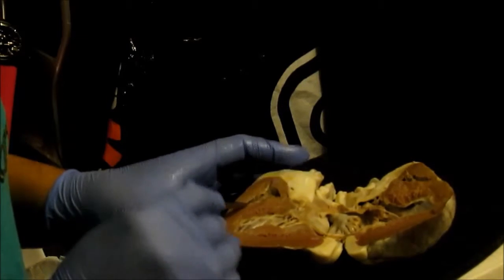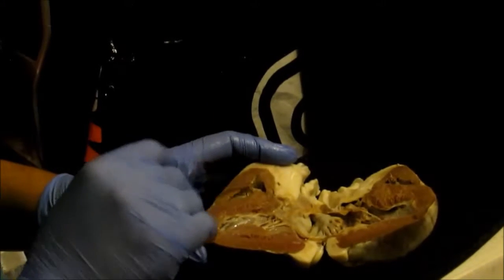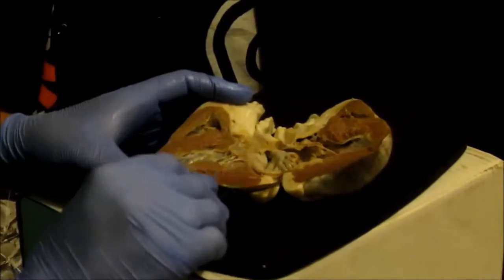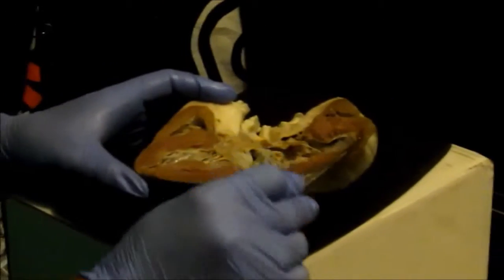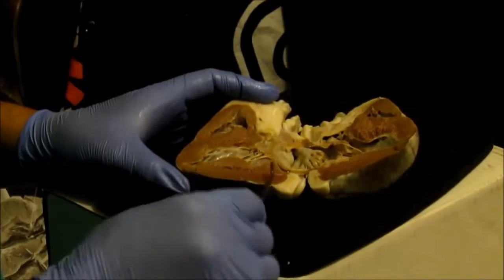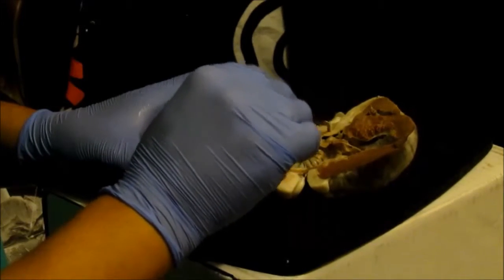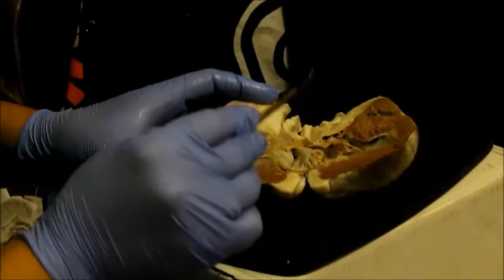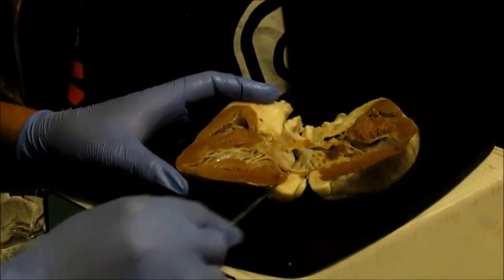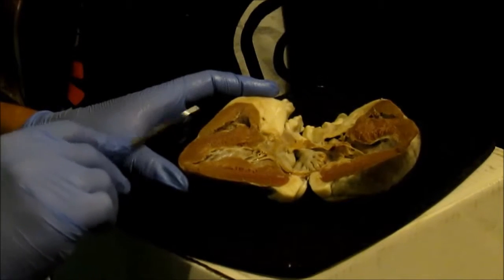The right ventricle has the deoxygenated blood, and then this goes into the pulmonary circuit to get reoxygenated. When it comes back into the left ventricle, the left ventricle needs all this muscle power to push it through the aorta so that the arteries, which are rich in oxygenated blood, can pump it into the rest of the body. That is why this is a lot thicker than the right ventricle.